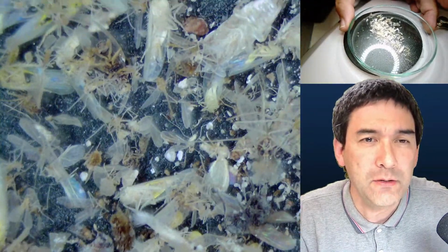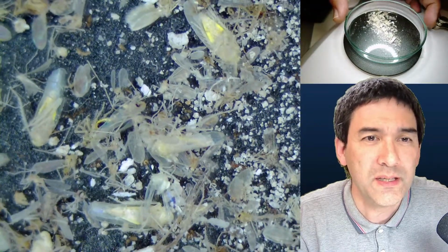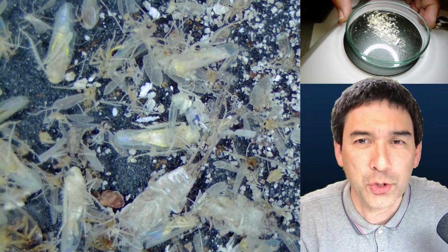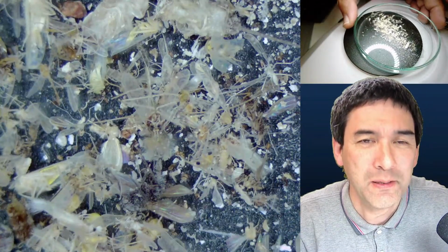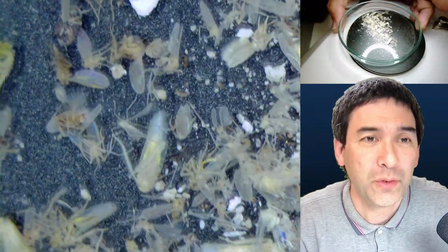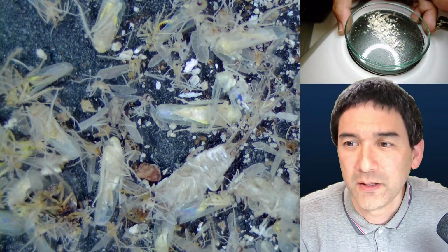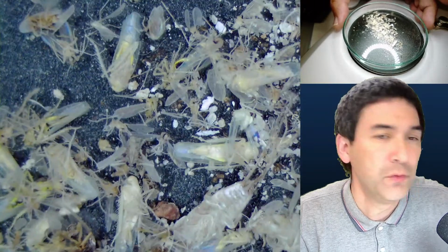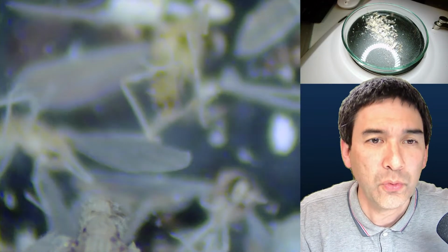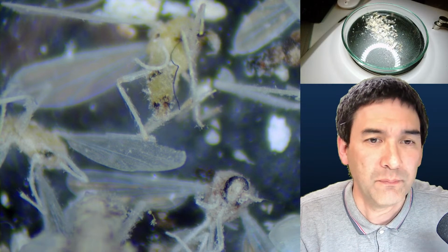But maybe you do notice something else. If you've already seen some of my stereo pictures before, the image quality is much better. It's actually much more crisp. The reason is because I've got a new camera, and the image quality is indeed significantly better, and I'm going to talk also about that. If you just want to look at some of those insects here, you can actually zoom in quite nicely. Of course you have to refocus again, but the clarity is significantly better than what it was before.